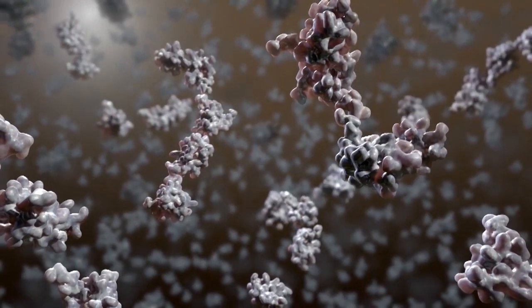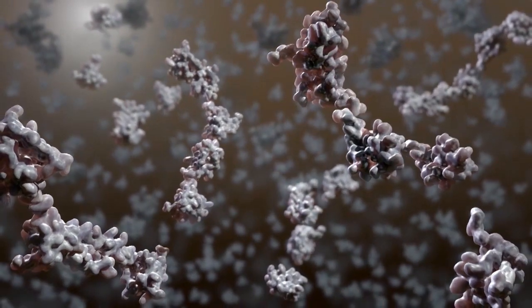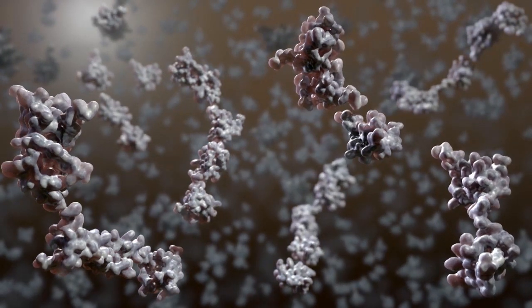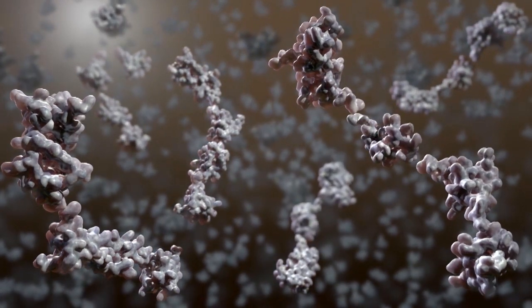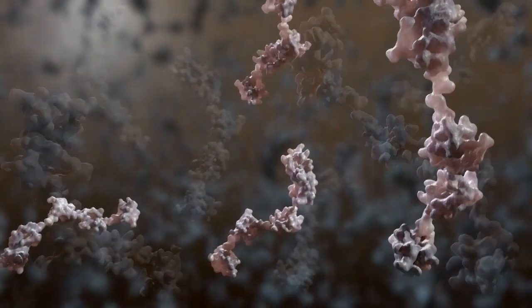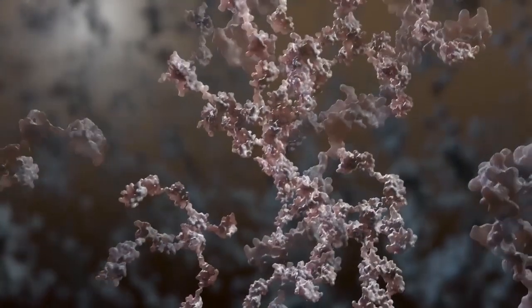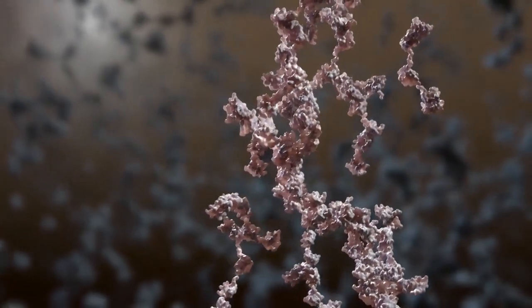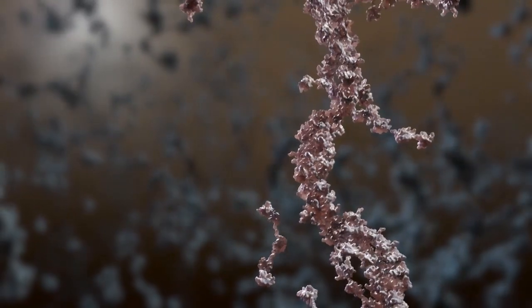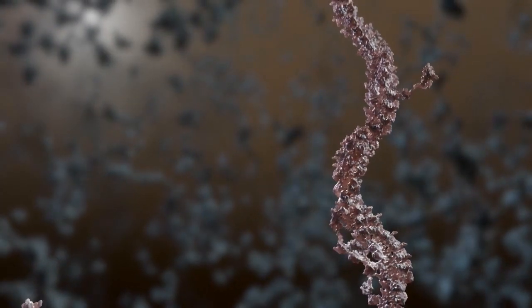For example, SAXS is used to study the formation of protein fibrils in diseases such as Alzheimer's and Parkinson's. What you see here are small protein molecules which are naturally present in healthy people, where they perform their normal functions. However, problems arise when the molecules start changing their shapes and properties. These changes cause the molecules to clot together and form aggregates, until finally insoluble protein fibrils are formed. These fibrils can become very large, and their accumulation in organs is known to cause more than 20 serious diseases.